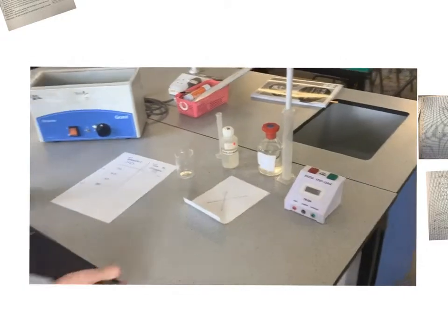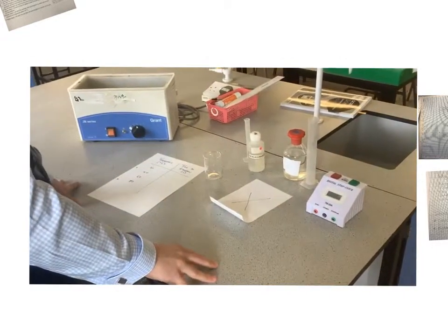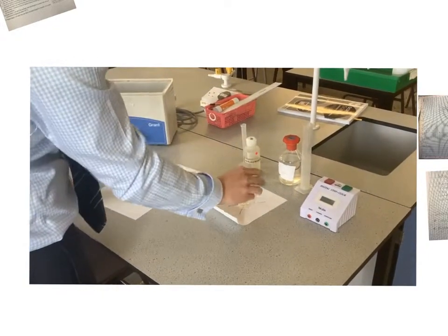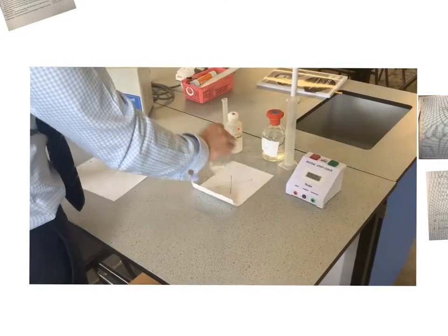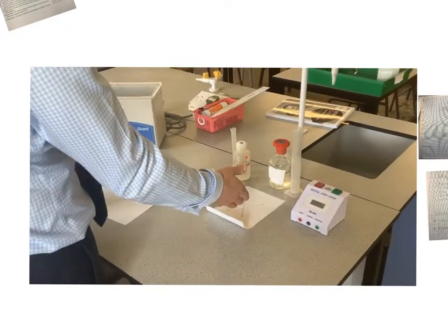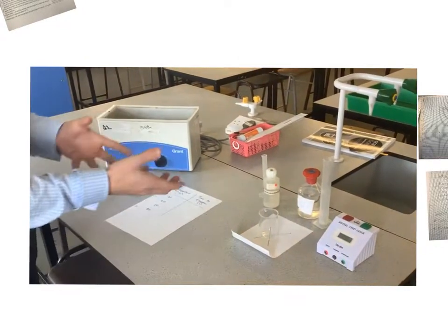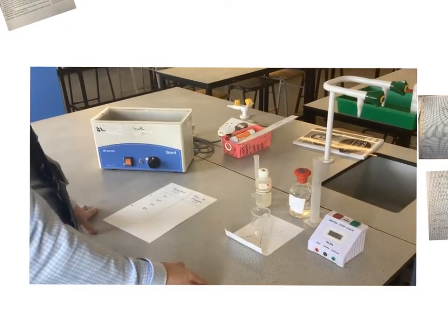Okay, and the whole idea behind this is we're going to have a reaction between the thiosulfate and the hydrochloric acid. It's going to form a precipitate, so it's going to go from being clear to being cloudy, so we're not going to be able to see that cross at the end. Now, just thinking of ways to improve this and make it more accurate would be to use a colour change meter rather than the eye, because you never know, you could get distracted and miss it, or you could just be thinking that the reaction is continuing when it's not.